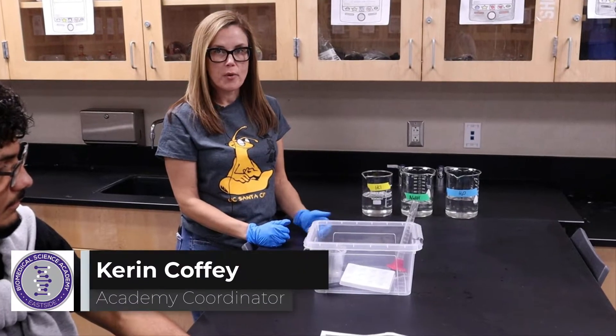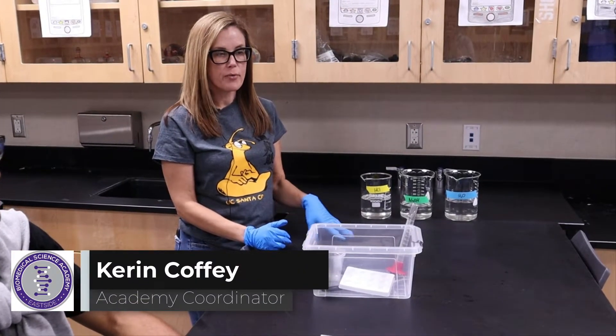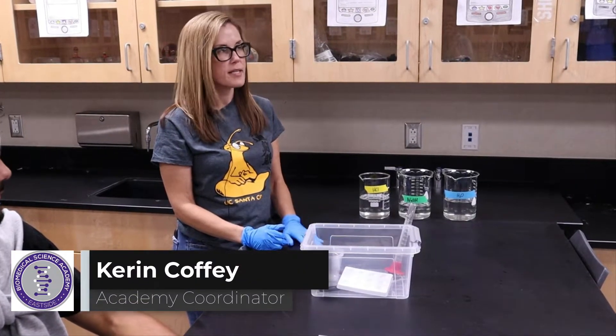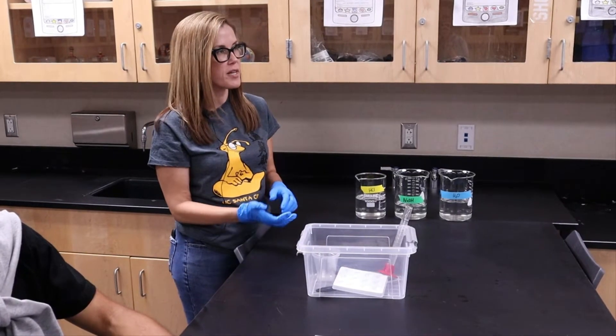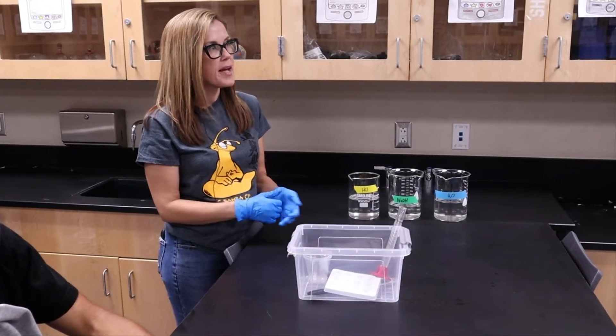This lab can be performed in a group of up to four students. Here we have two students that are going to be performing the experiment for us today.